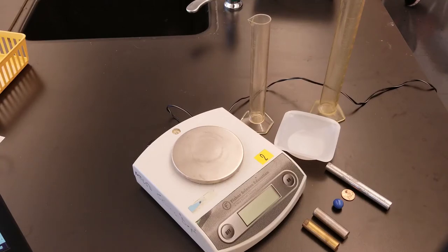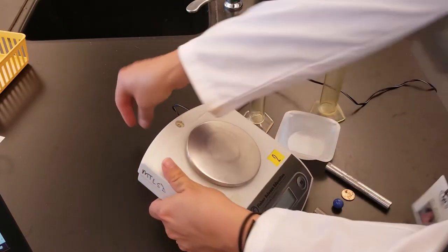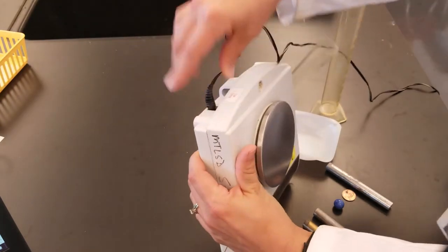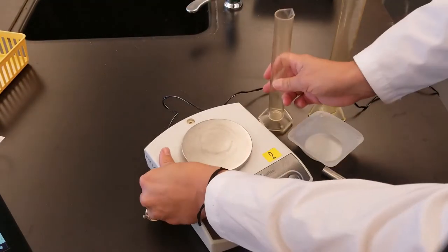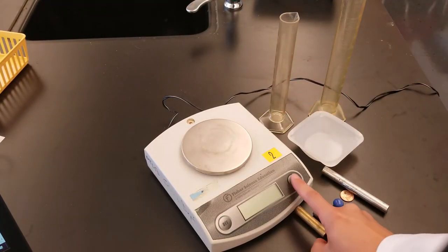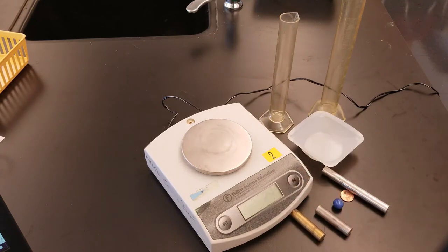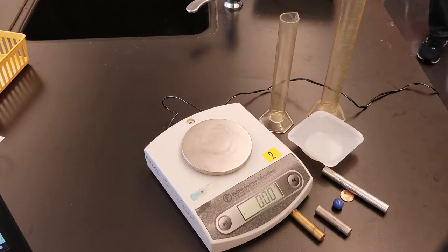To turn on the balance you first need to plug in to the back of the device. Wait until the display shows 0.00 grams.